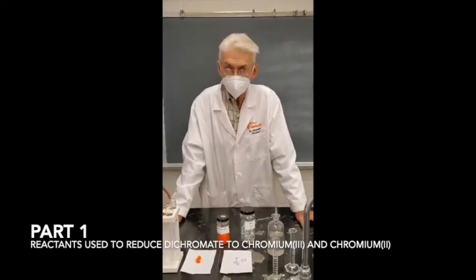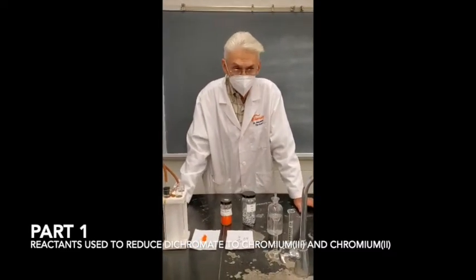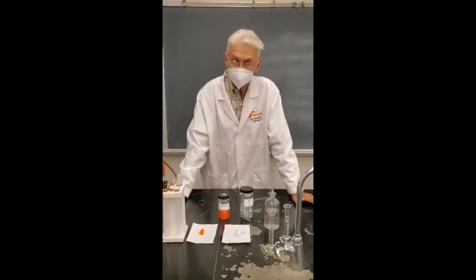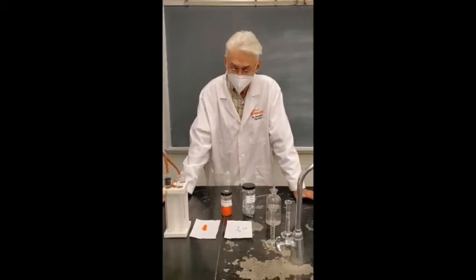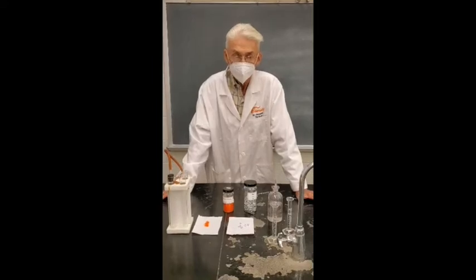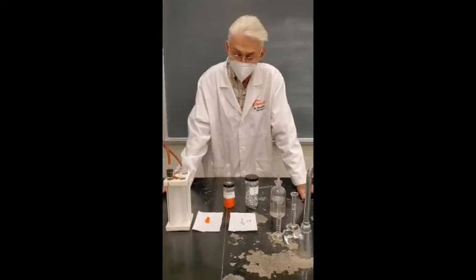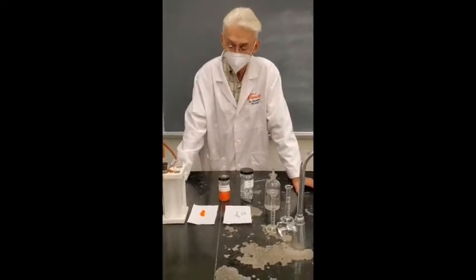Good morning, everybody. We're going to do an experiment on the transition elements. One of the characteristics of transition metal compounds is that they have beautiful colors, so we'll illustrate that using chromium. And one of the properties of the transition elements is that they have multiple oxidation states. In the case of chromium, they have oxidation states from +6 all the way down to -2.